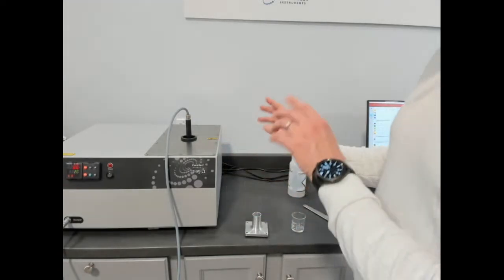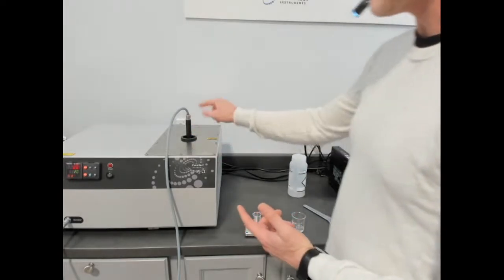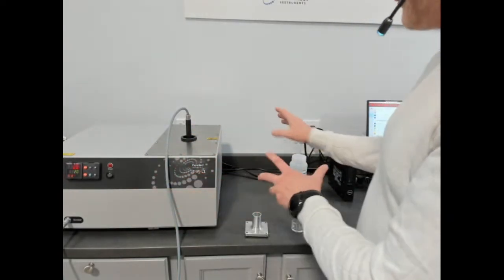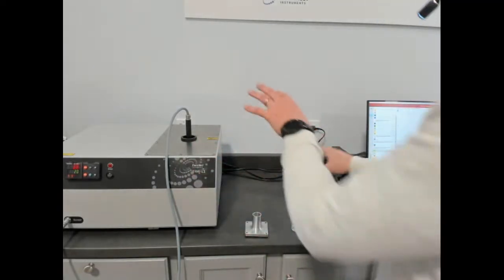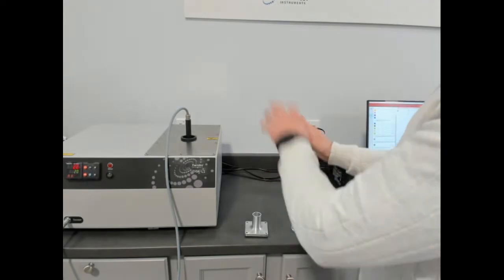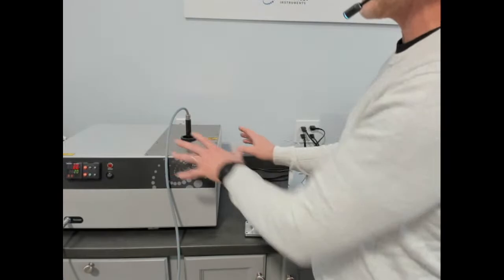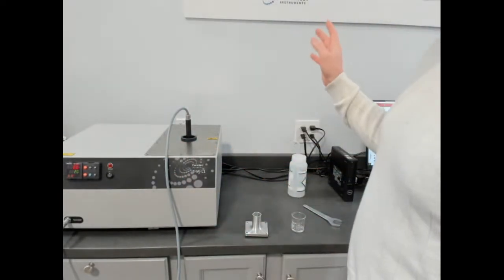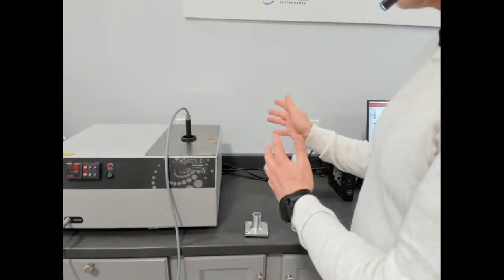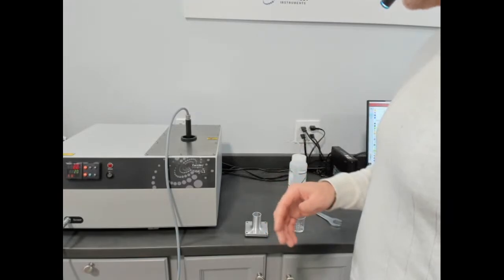So for that minus 45 to 300 Celsius that I was referring to, the sensor never leaves this port. That cooling is done within the device itself. There are some other makers of the transient hot wire method where you have to switch to another cooling device if you go below a certain temperature. We can set up one schedule because this is all integrated, allowing a full range of temperature, whether cryogenic or subambient up to high temperature. So that's a big advantage. And of course, we get very good temperature stability.